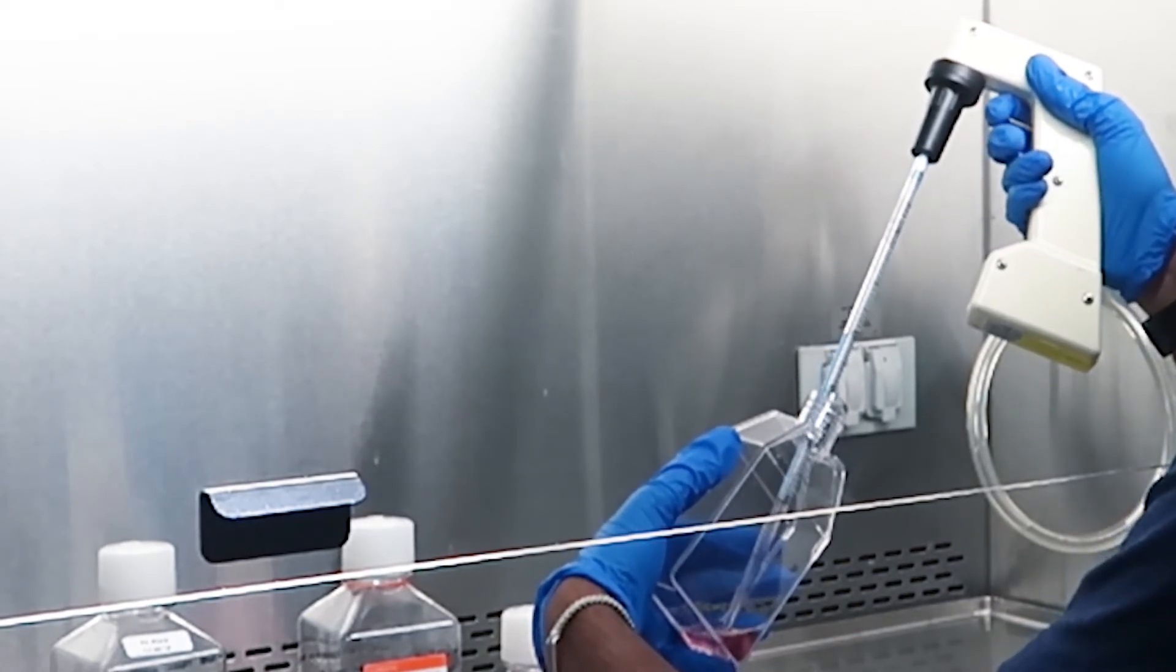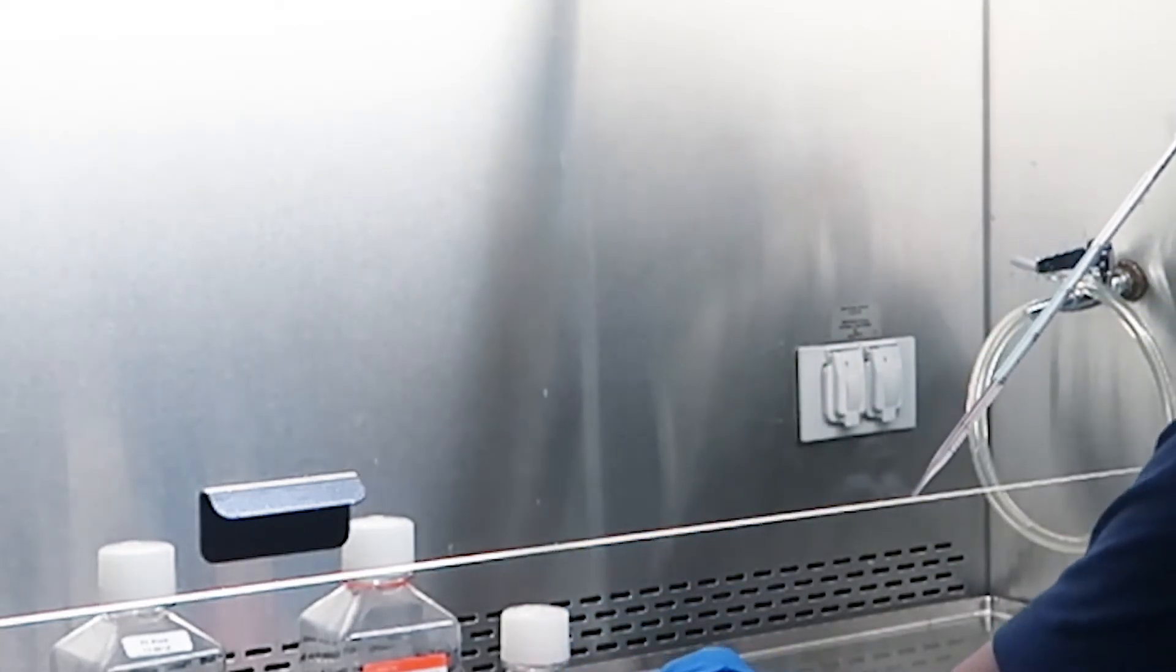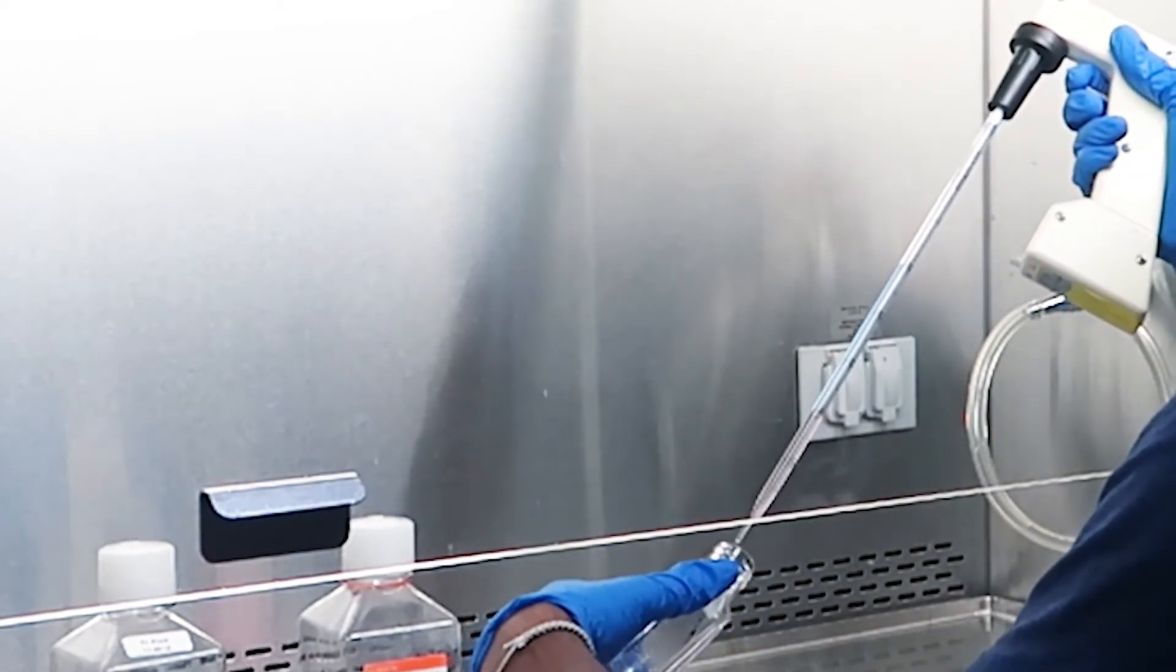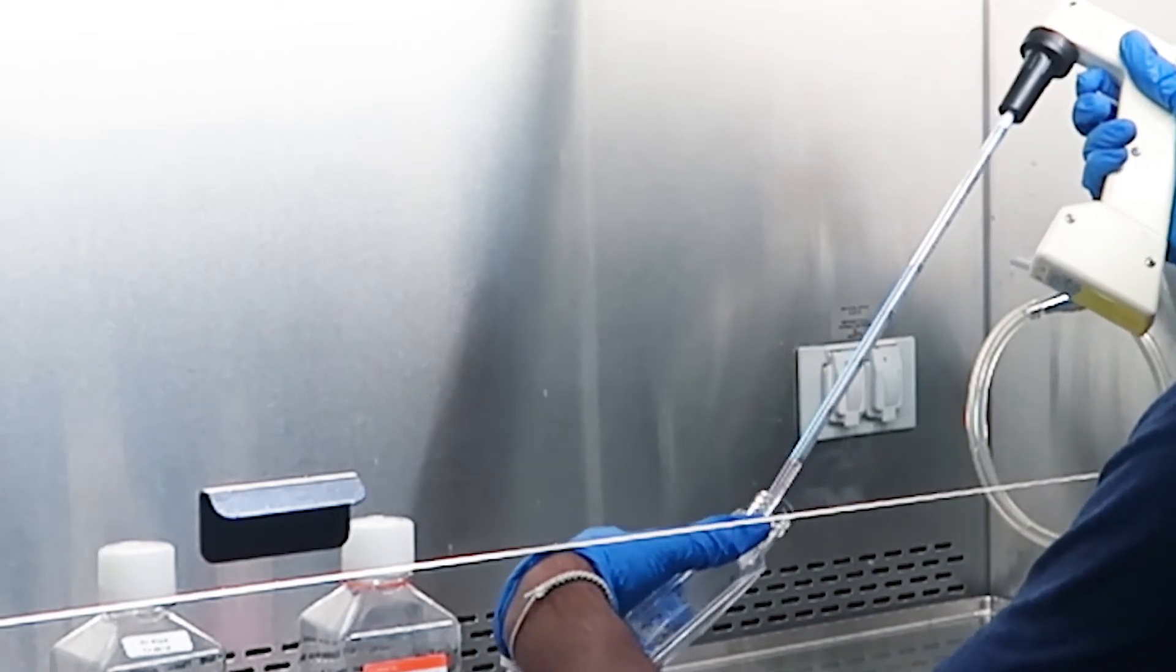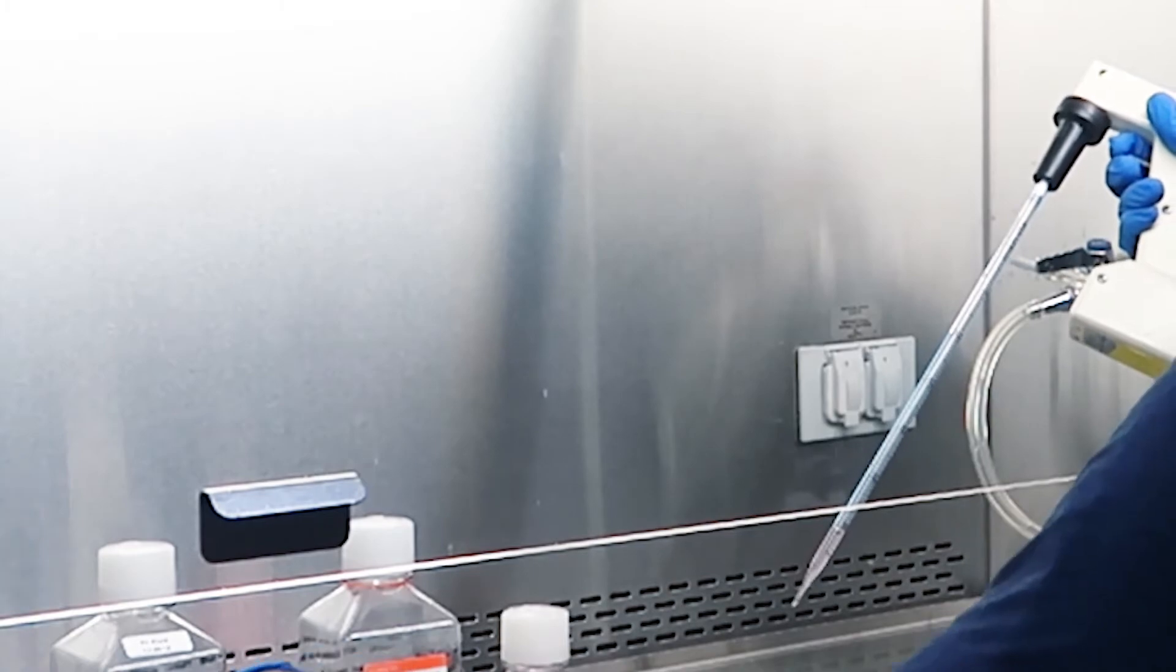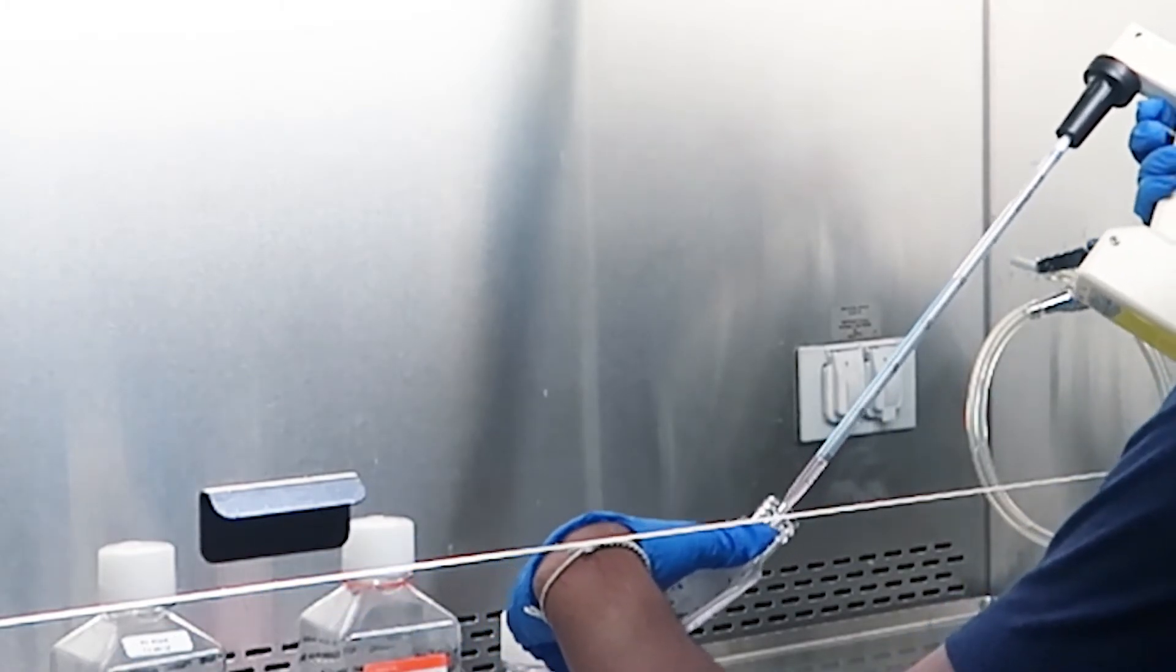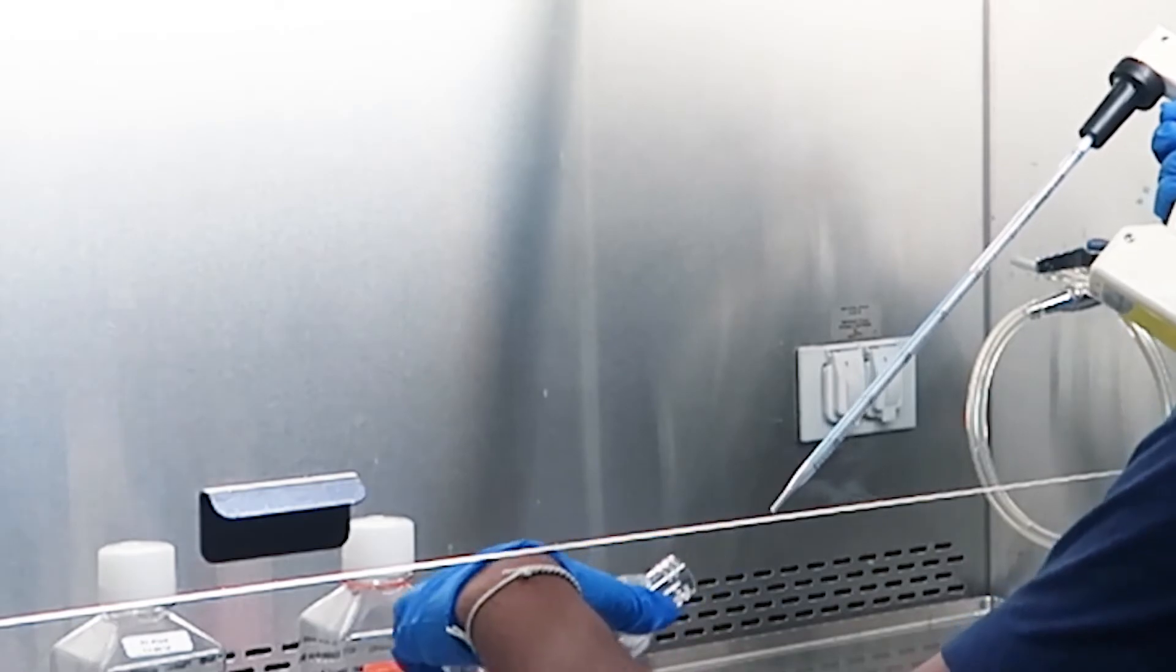Here in this case I'm creating two one to ten flasks and so this can last me about three to four days. These are just recommendations for ratios and the precise cell density can be measured by counting your cells and you can calculate exactly what splitting ratio you want.